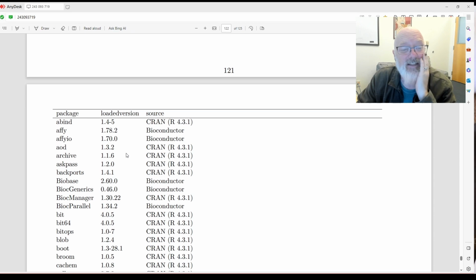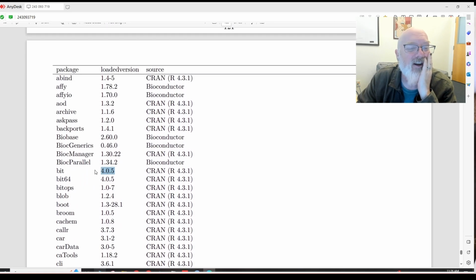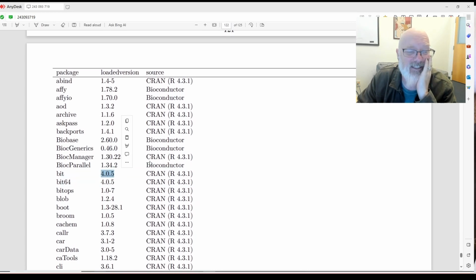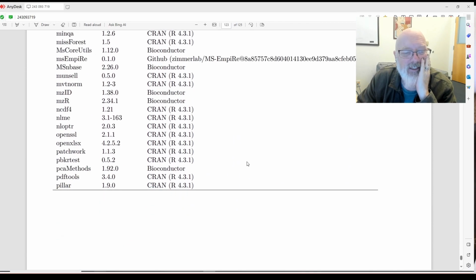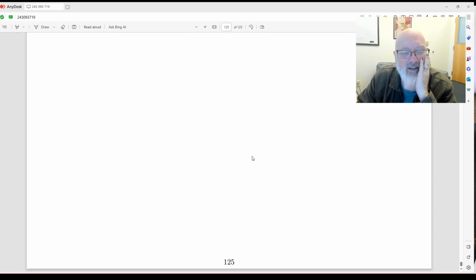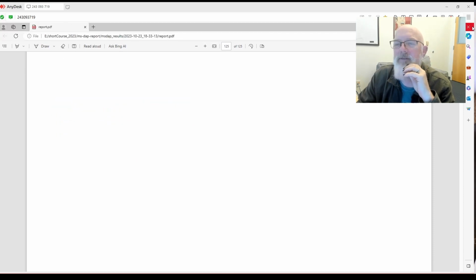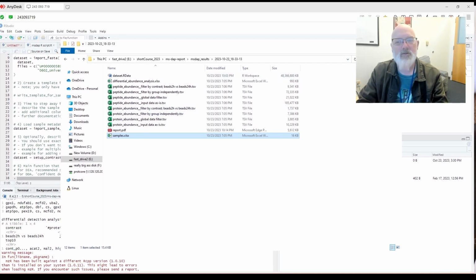Maybe a data forensics person can go back and look at this 10 years from now and say, oh, your bit loaded version was 4.05, and now we know that's terrible. So this is probably nothing you need to worry about now, but maybe you can go back later and someone can make sense out of it. And that's it. 125 pages of reports. MS DAP seems super cool so far.